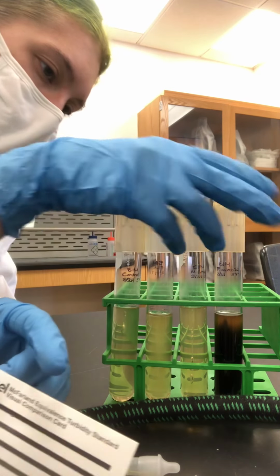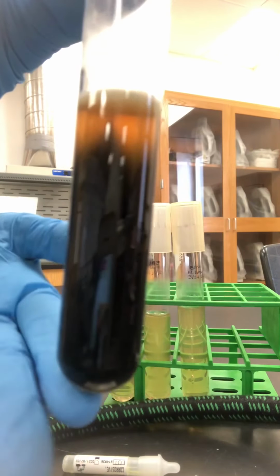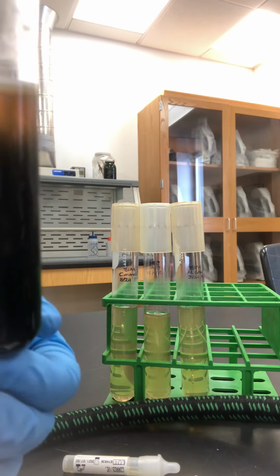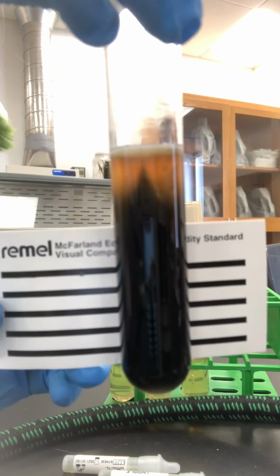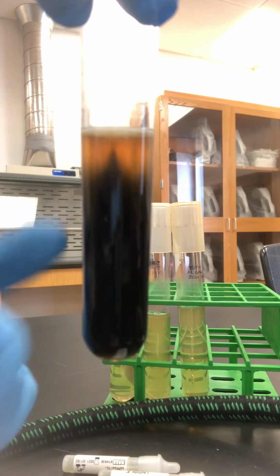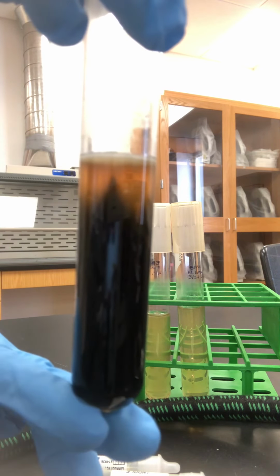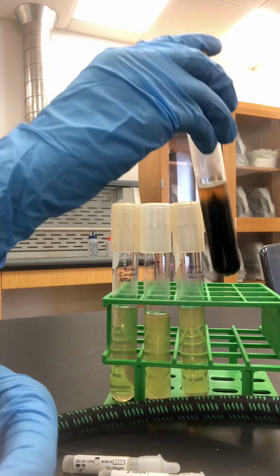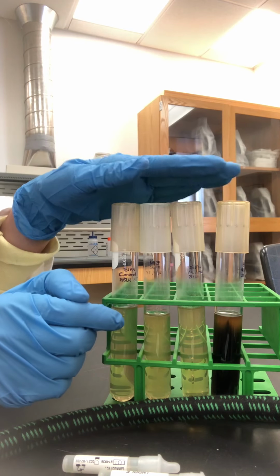Our last organism that we're looking at here is Proteus mirabilis. We can't really tell, well, I guess you could tell if it's motile, right? Because there's not just growth around the stab, but there's growth throughout the medium, and it's black. So the black tells us that this produces hydrogen sulfide, so that is positive for the sulfur test. So that's looking at them for motility and hydrogen sulfide production.